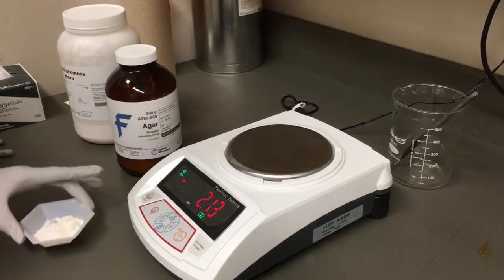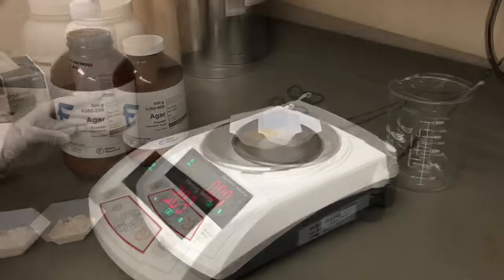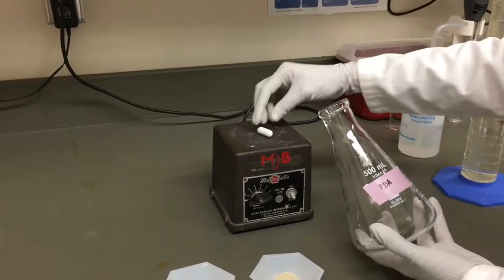Weigh different components separately. If you add them together in the same weigh boat, you will not be able to remove material to adjust the weight as they will be mixed. Make sure you wash your utensils after every use.